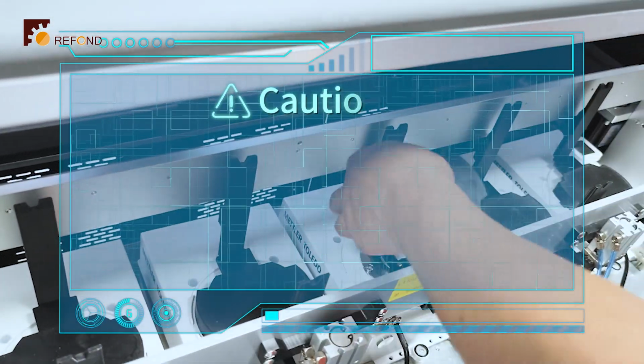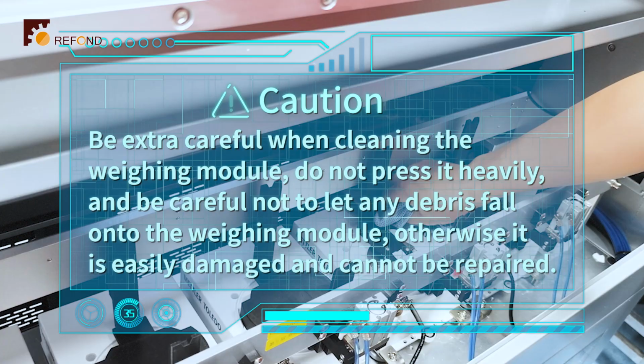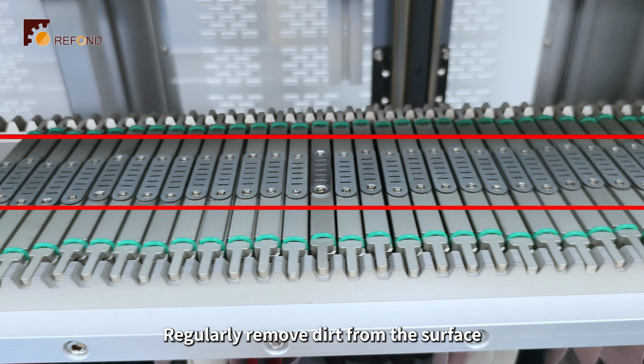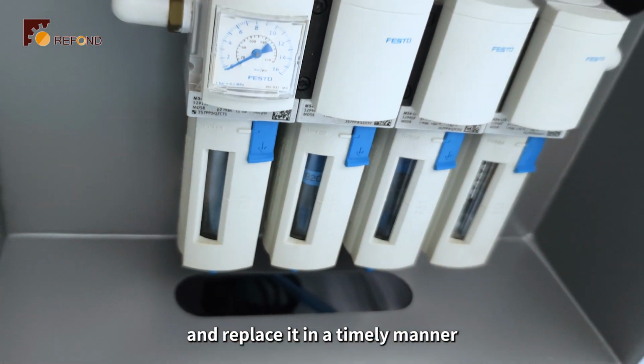Caution: be extra careful when cleaning the weighing module. Do not press it heavily, and be careful not to let any debris fall onto the weighing module, otherwise it is easily damaged and cannot be repaired. Regularly remove dirt from the surface of the sample clamp iron sheet. Regularly inspect the air filter and replace it in a timely manner.